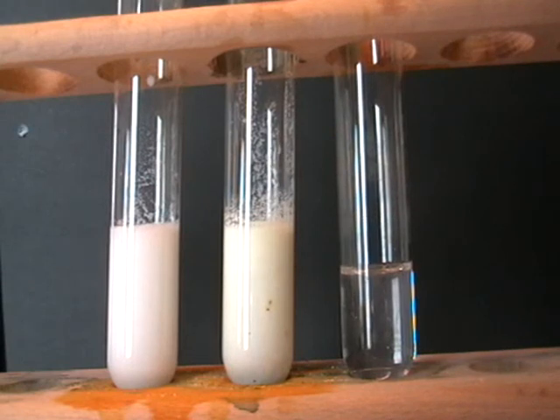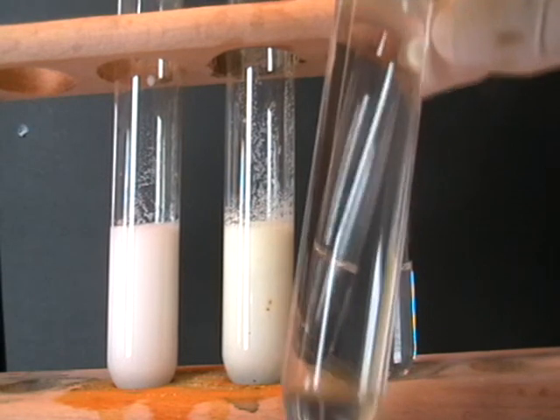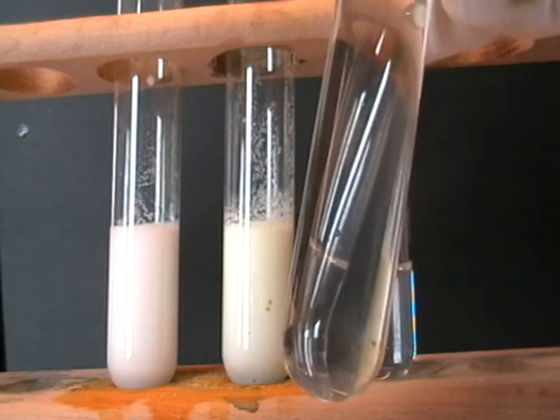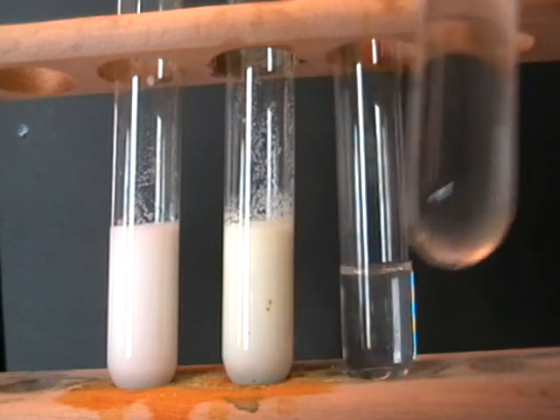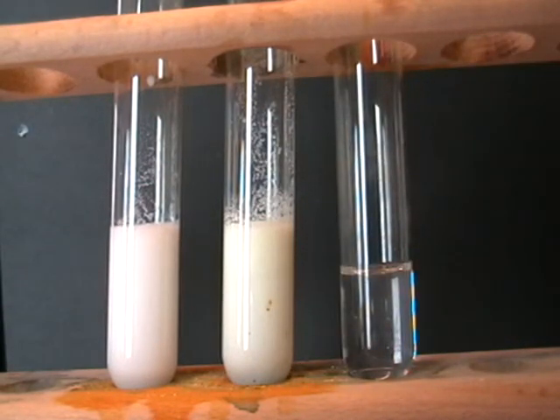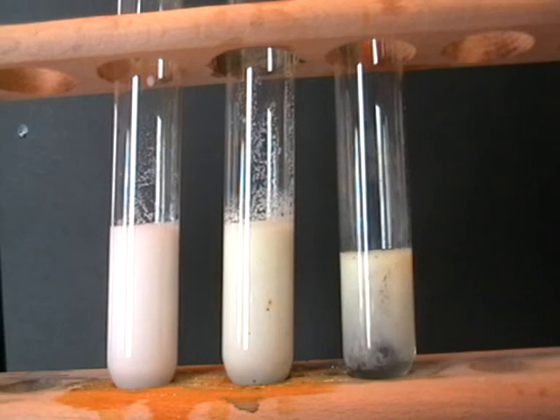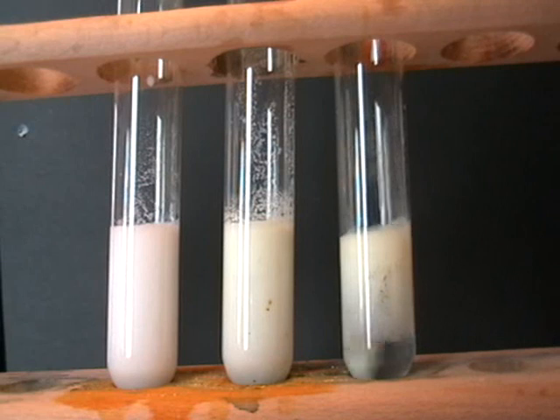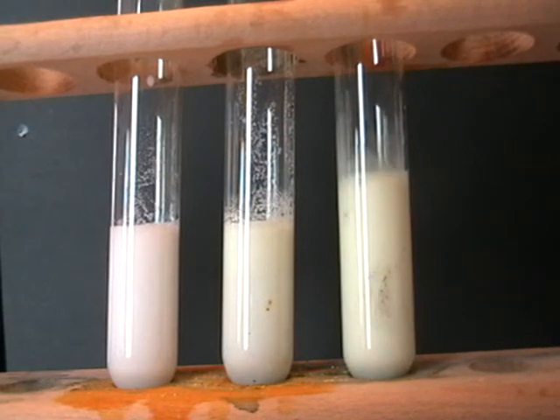Let's see what happens with the iodide salt. We add the acidified aqueous silver nitrate to the aqueous sodium iodide solution here on the right. Here we go. Just a few drops, first of all. Again, a precipitate forms immediately. And this is a yellow precipitate. We'll be able to see it maybe a little bit more clearly in a moment.